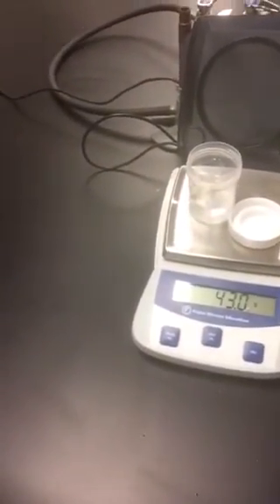Halfway with water. And I have a piece of Alka-Seltzer here, a little chip. It goes on the cap, and we weigh the system together. Please record 43.0 grams for your before.